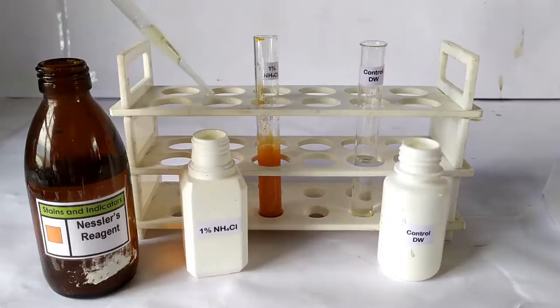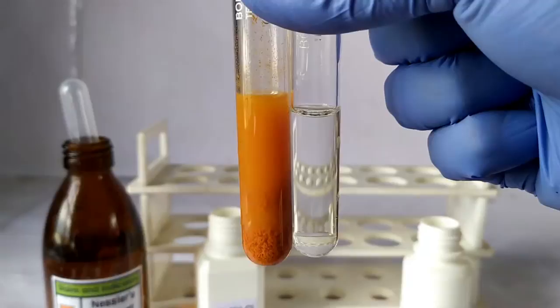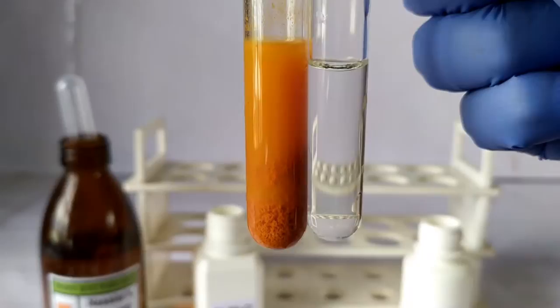The intensity of the color is directly proportional to the concentration of ammonia or ammonium present in the sample. The control tube, on the other hand, does not show any color change as expected. So this is how the presence of ammonia or ammonium in a sample can be easily detected qualitatively in a simple manner.